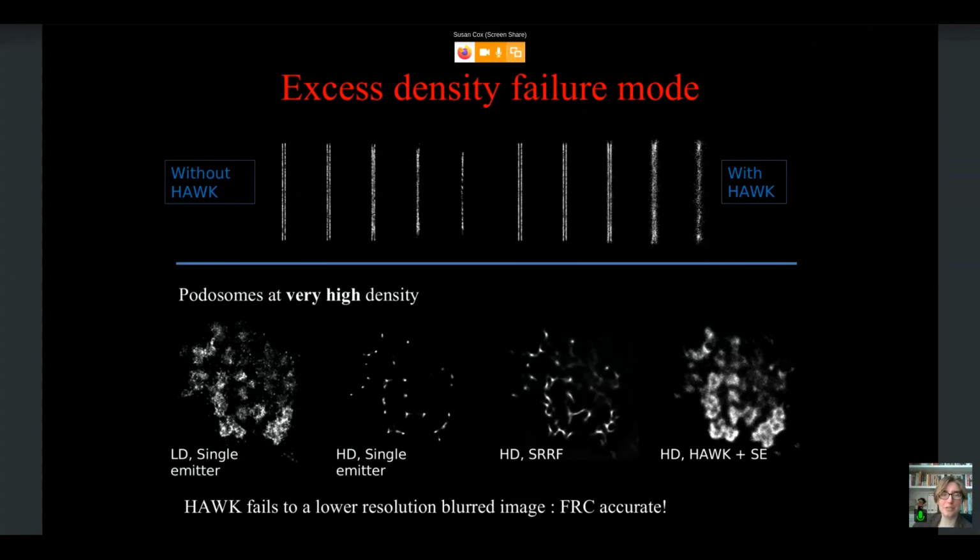And here on the top, on the left, I'm showing what the results look like without Hawk, and on the right with Hawk. And on the bottom, I'm showing what happens when you have very, very high density of podosome data of the type that we'd already seen. And you can see that Hawk doesn't necessarily get you something that looks super resolution, but it also doesn't look artificially sharpened. So Hawk is not going to give you an amazing resolution if your data isn't capable of that.